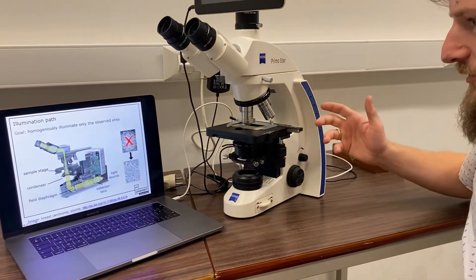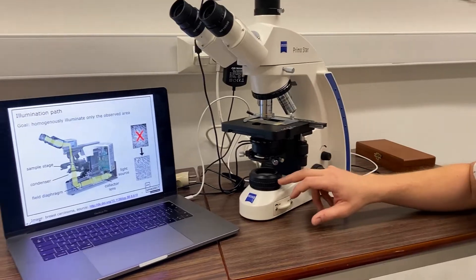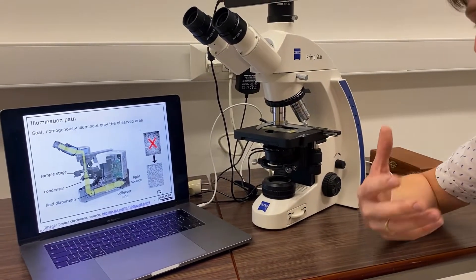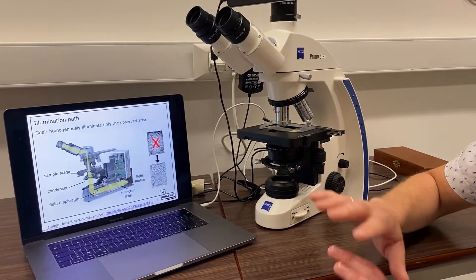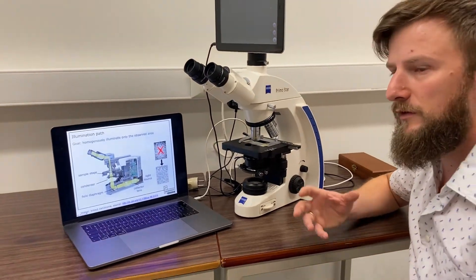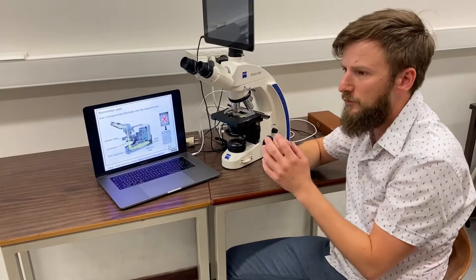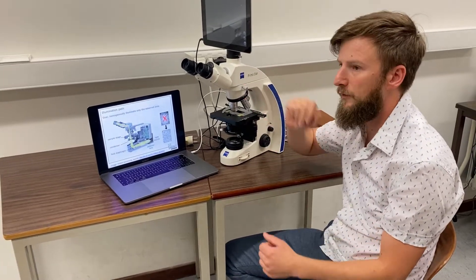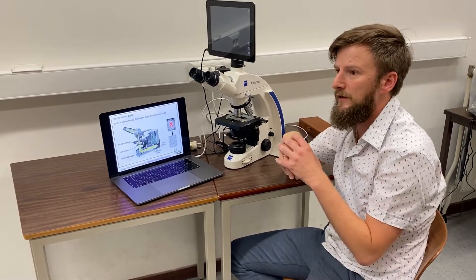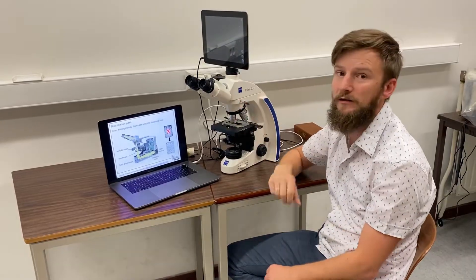The function of this illumination part, consisting of the lamp, the field diaphragm, and the condenser, is to illuminate the sample in a homogeneous fashion so every part of the sample is illuminated equally well. But it's also used to determine the region of the sample that you actually want to illuminate. You don't want to illuminate more than you observe through your eyepiece or on the camera, because everything that you illuminate and don't observe possibly causes an increased background in the part that you do observe.